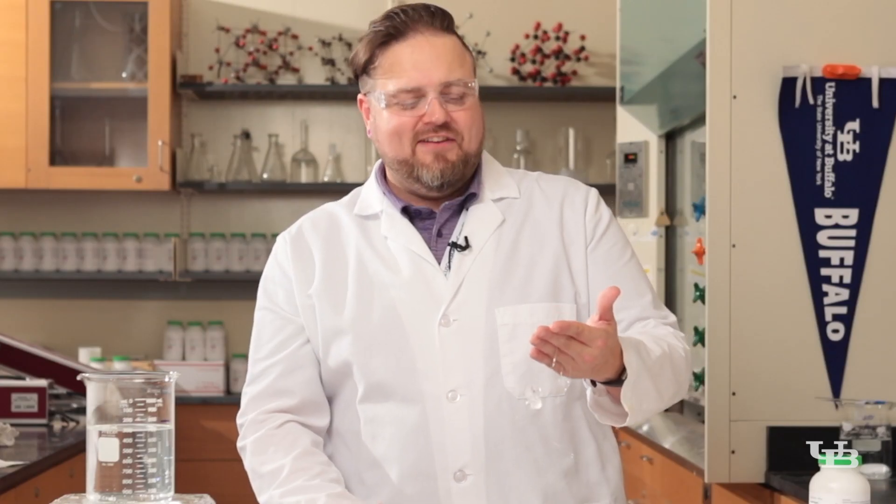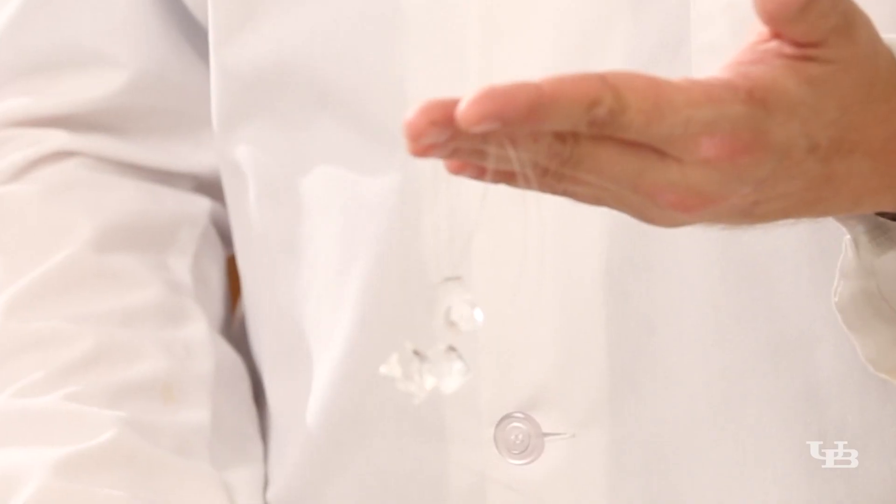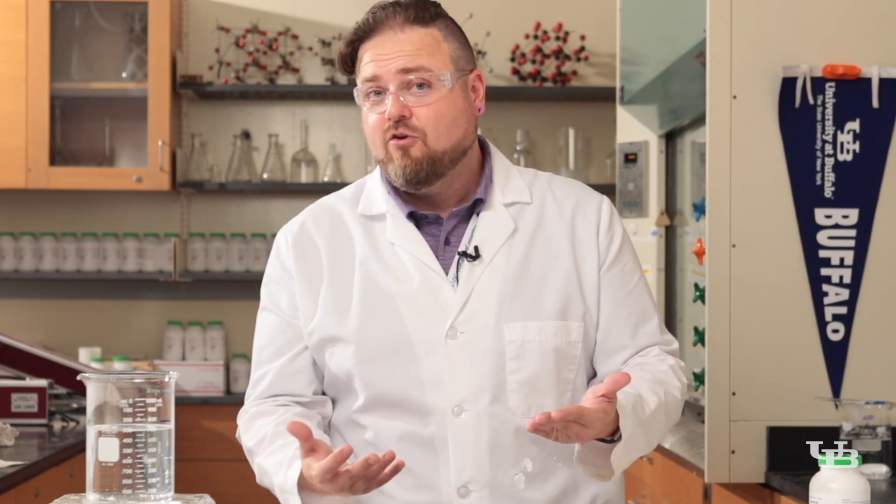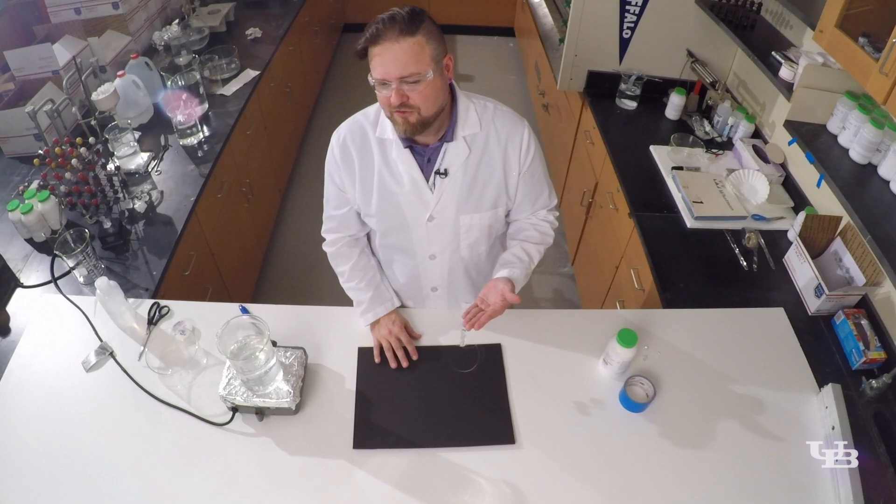It's actually a good idea to prepare a few seed crystals because we'll be taking these seed crystals and putting them into a solution of alum and a lot can go wrong. You may need a backup seed crystal.